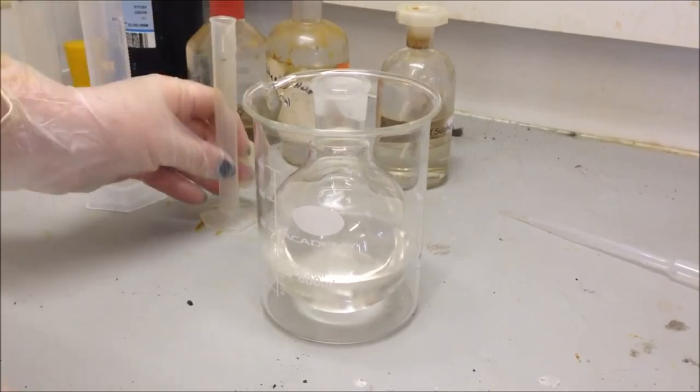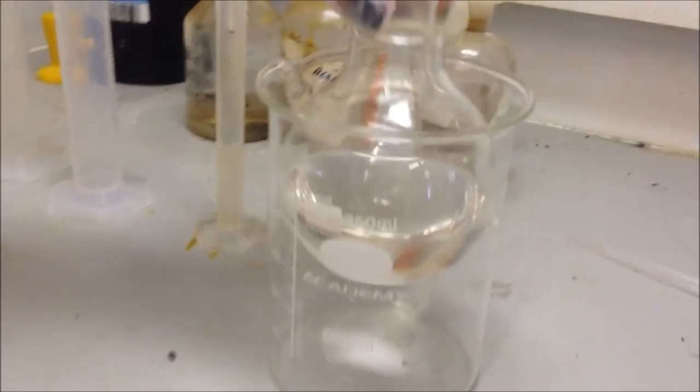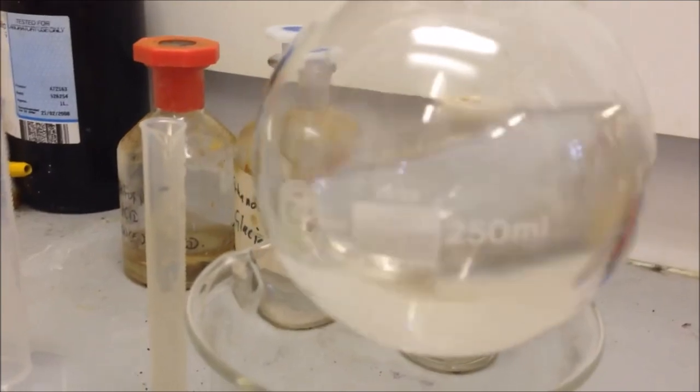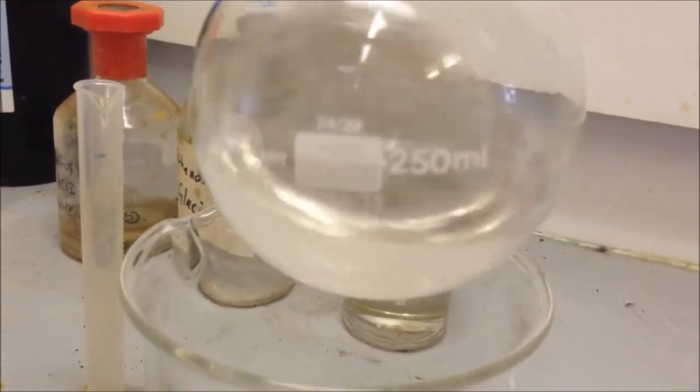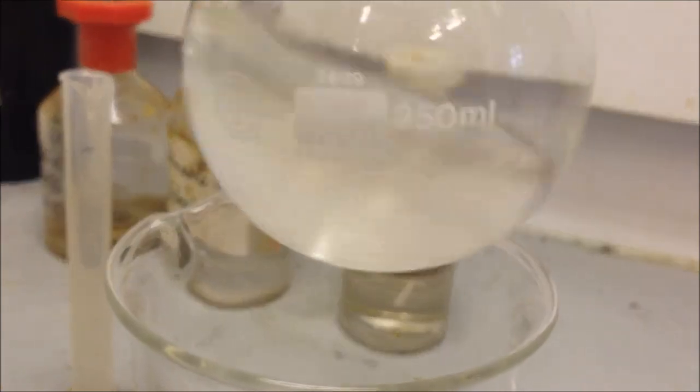You can see if you look closely the concentrated sulfuric acid changing the look of it because it's concentrated.